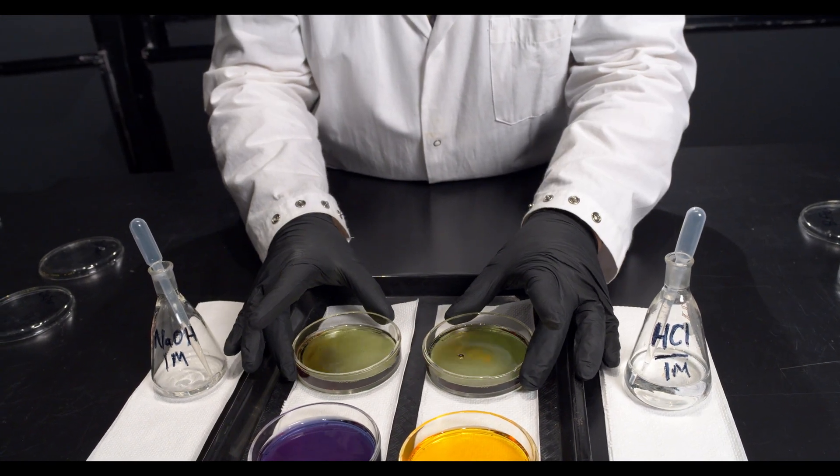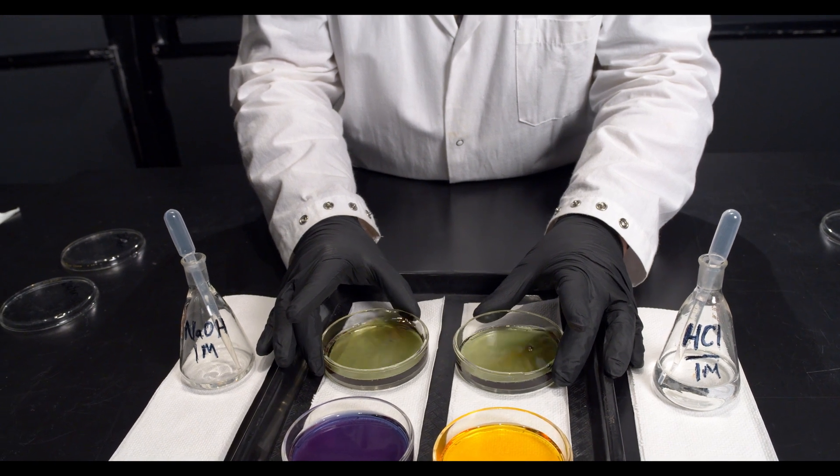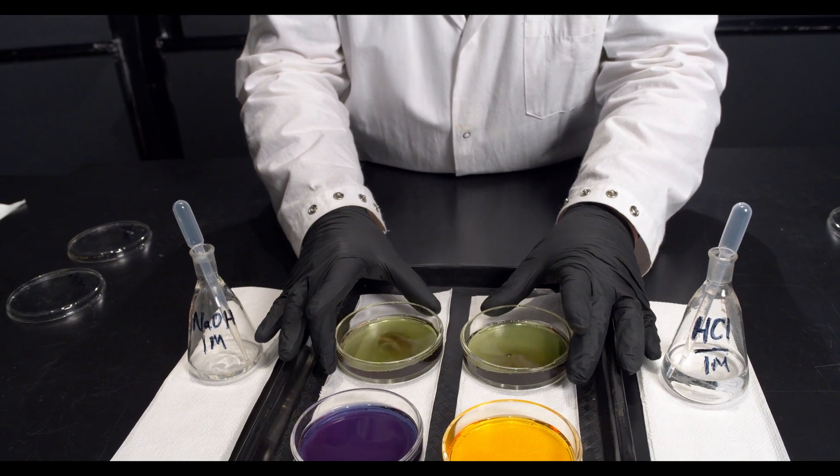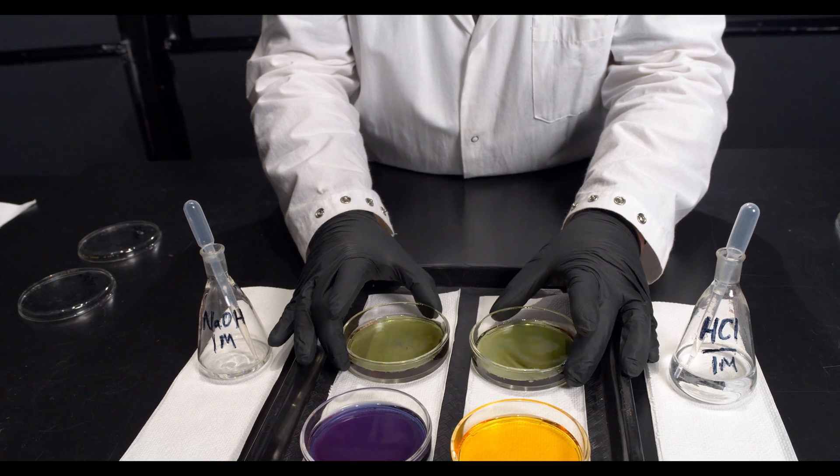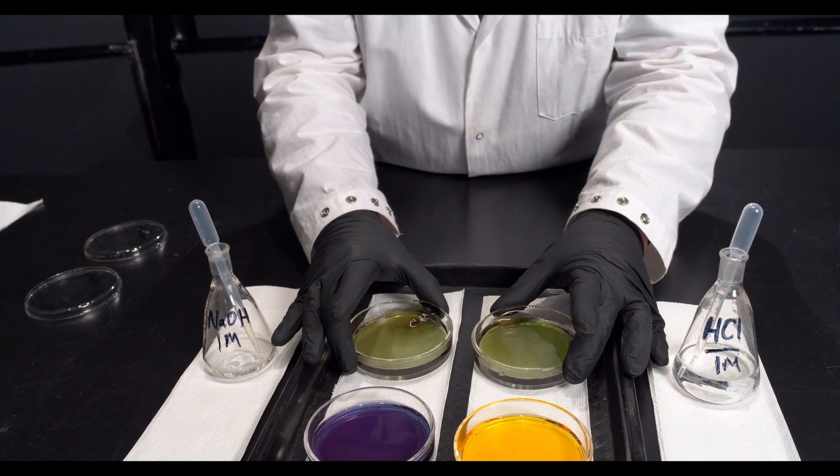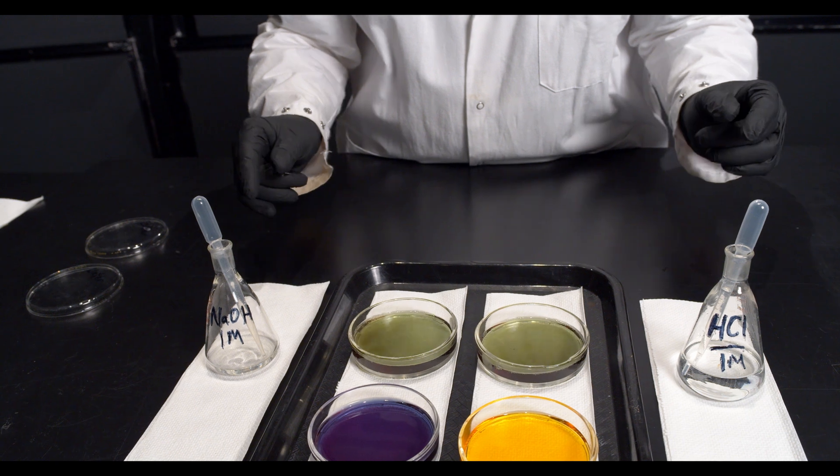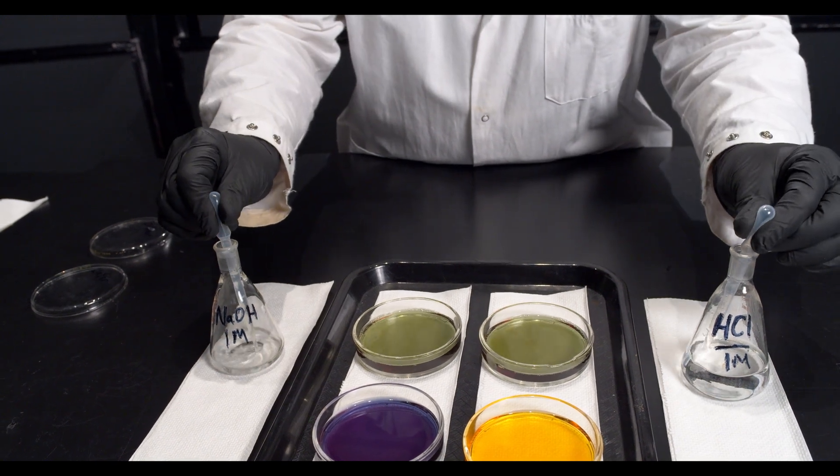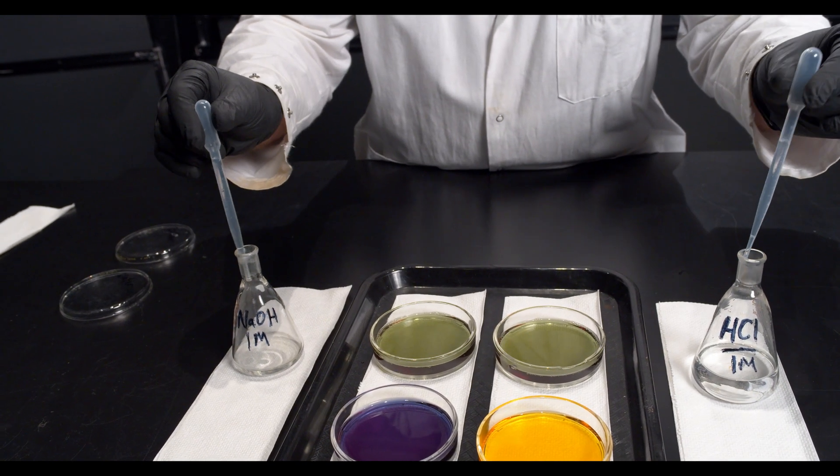You can see that locally you get a little bit of a change, but once I swirl it up, it's like I didn't change anything at all. Those solutions are both neutral.